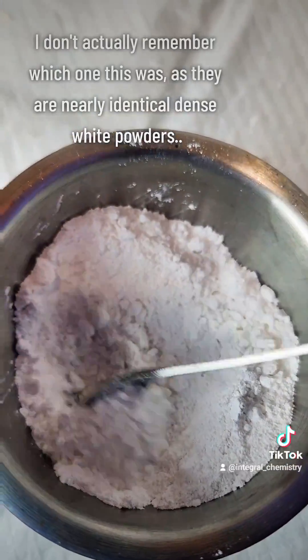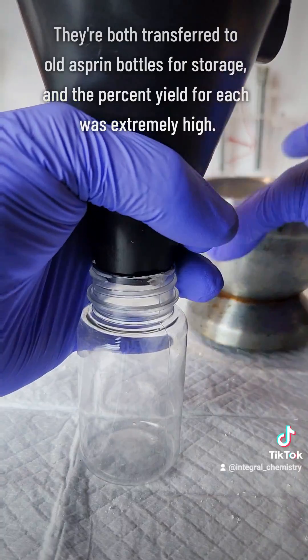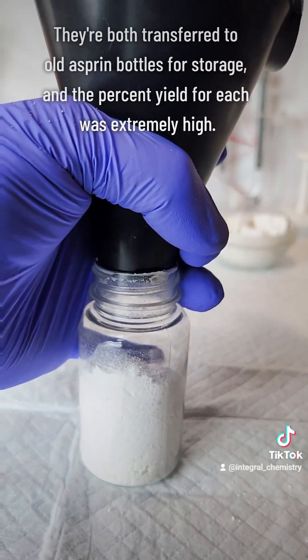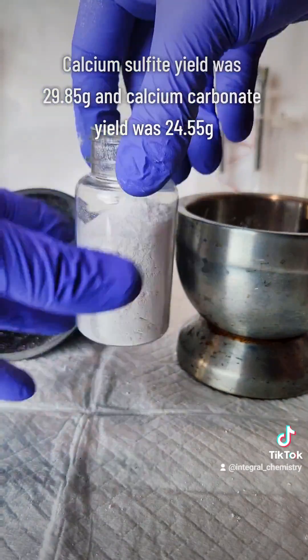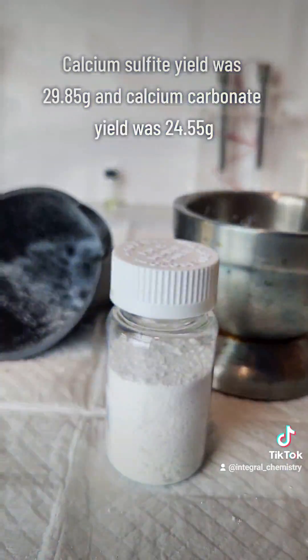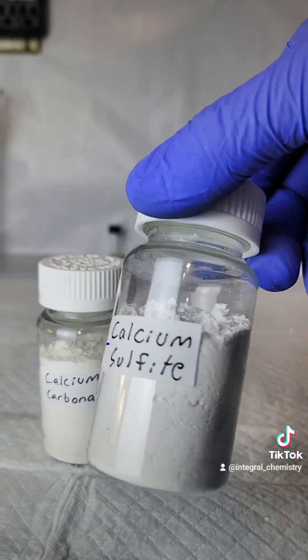My yield for calcium carbonate was slightly lower, and that's only because I couldn't scrape all of it out of the drying dish. In any case, that's the entire process. I hope you found this interesting, or at least informative, and if you liked this and want to see more science, consider giving me a follow.